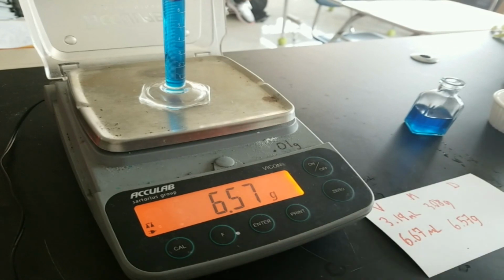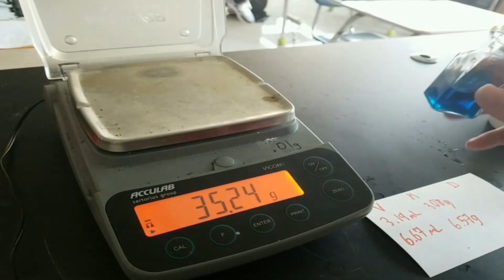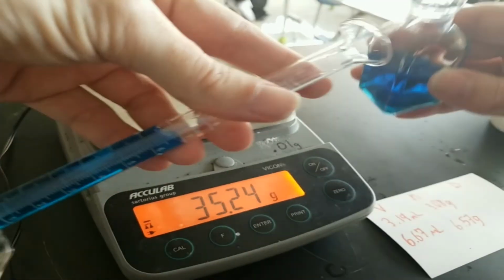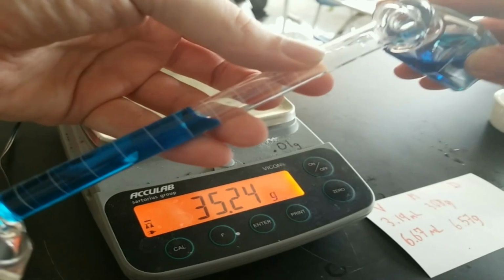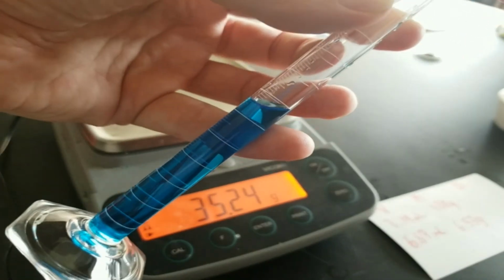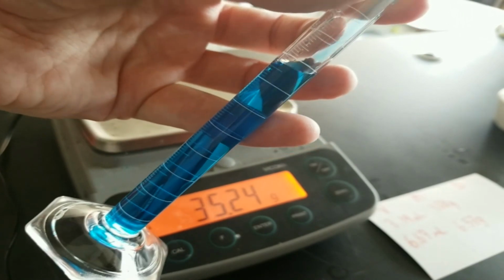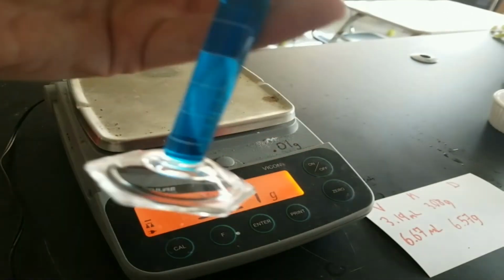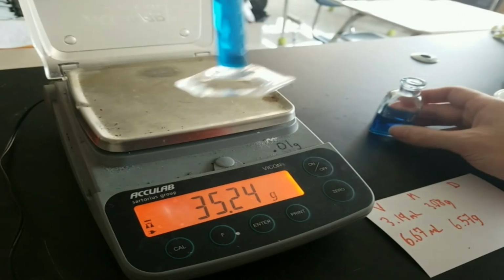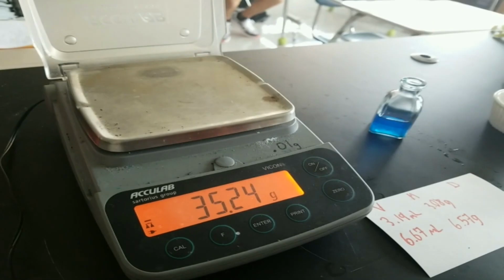And then I do my third. Now be careful, you do not want to pour this over the 10 line. You'll have to reset, you'll have to restart, throw that data out. So you want to be careful here, all right? Since I decided on 3, 6, and 9, I want to make sure I get it to the 9. Now, I did not quite get it to the 9, as you can kind of see there, but again, that's okay. I'm going to lower myself down to eye level.